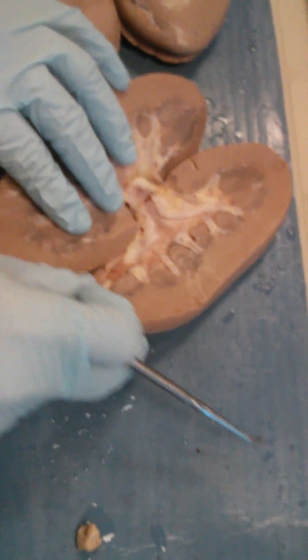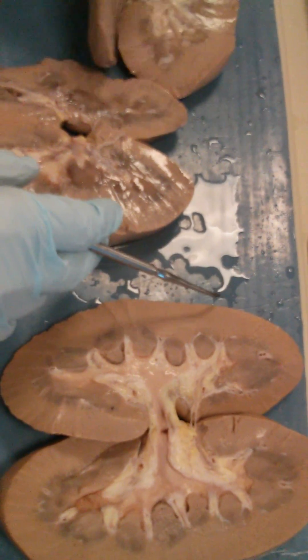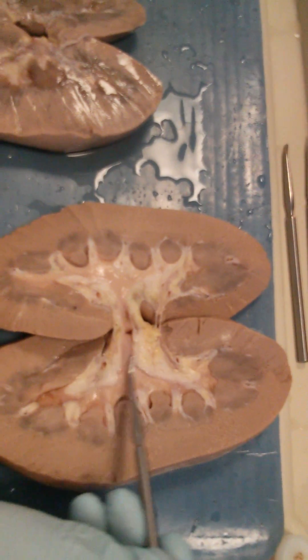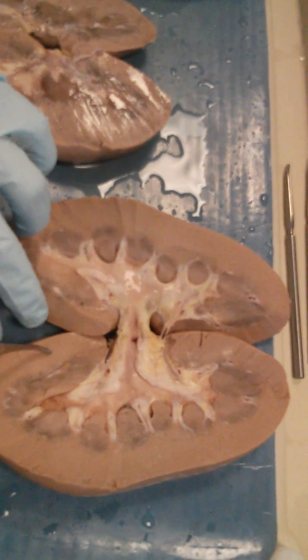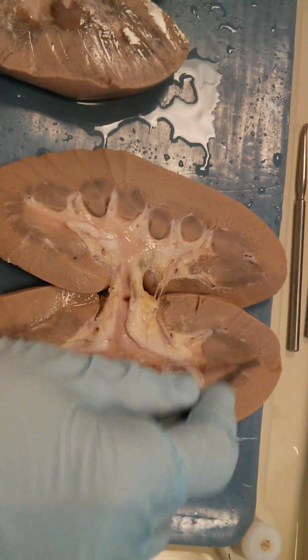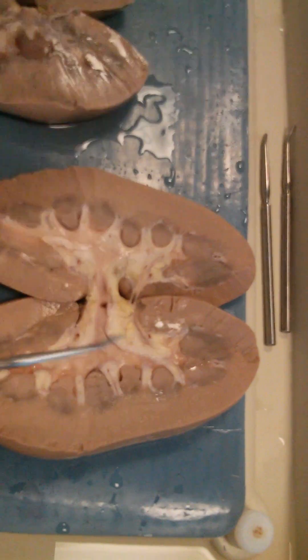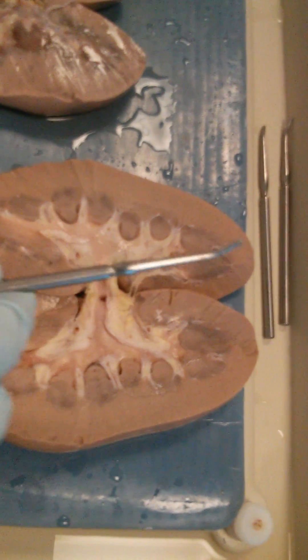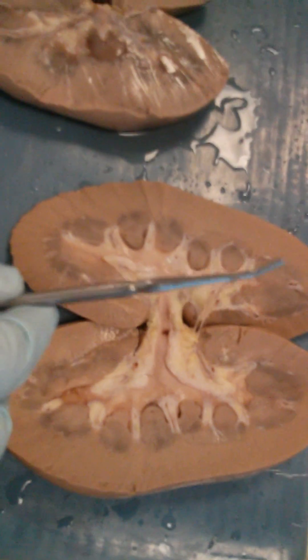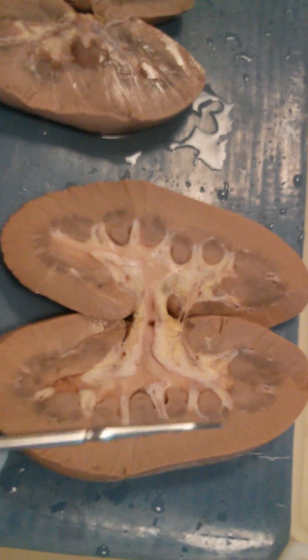Here is the pelvis of the kidney. This entire outer region is the cortex, and the inside is the medulla — though we don't use the term medulla as much in the kidney. Whenever it is not the cortex, it is the medulla.